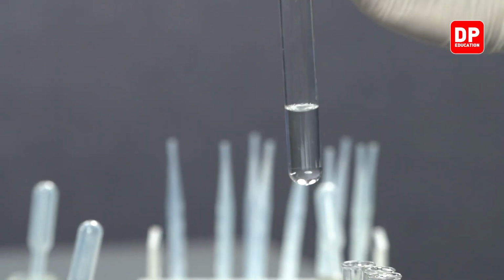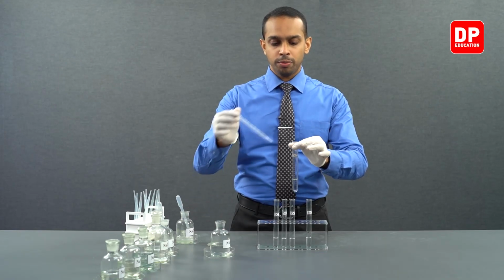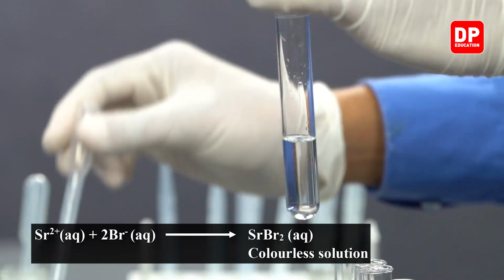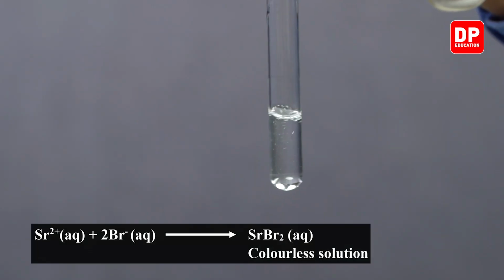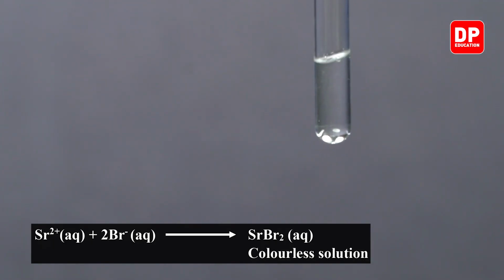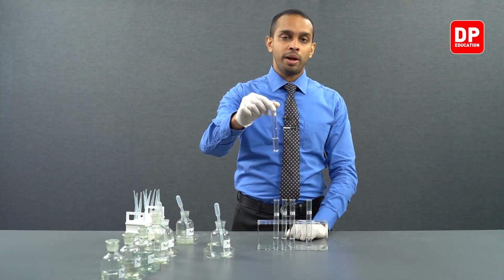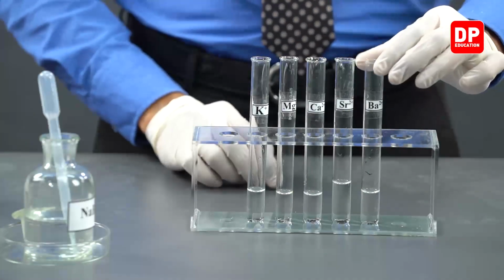We have strontium 2+ ions here. If we add a small amount of bromide ions into this and give it a little mix, you can see even when it comes to strontium 2+ ions reacted with bromide ions, we will not form a precipitate because the strontium bromide formed is soluble in water.